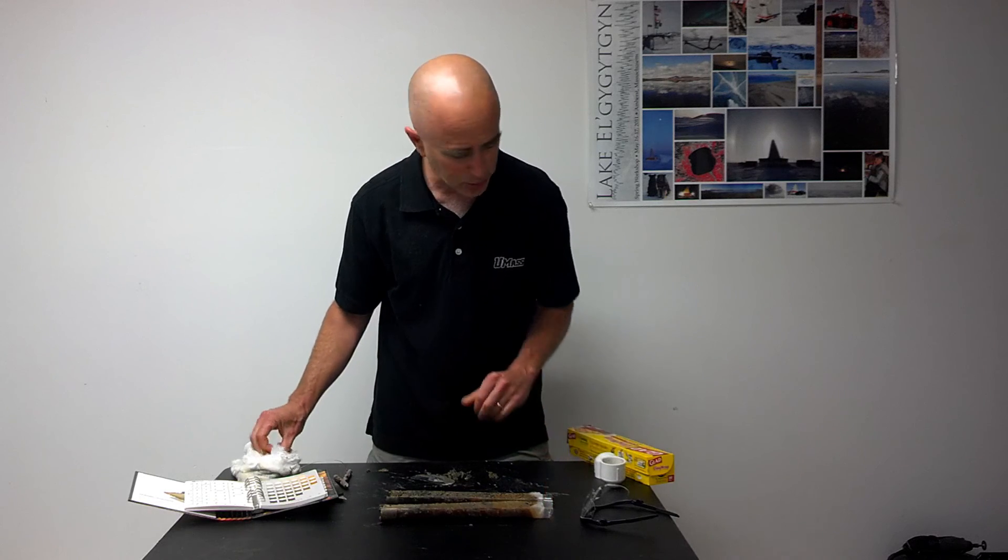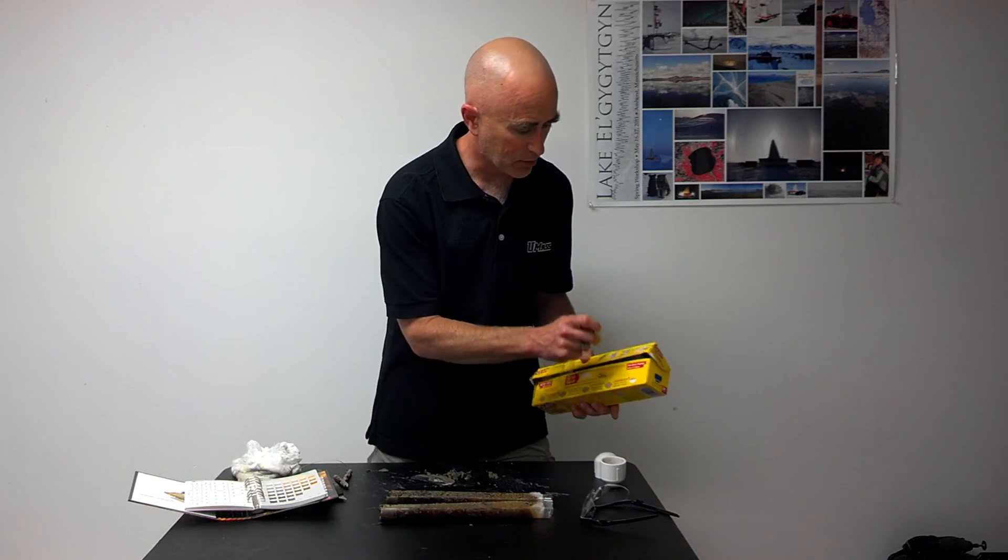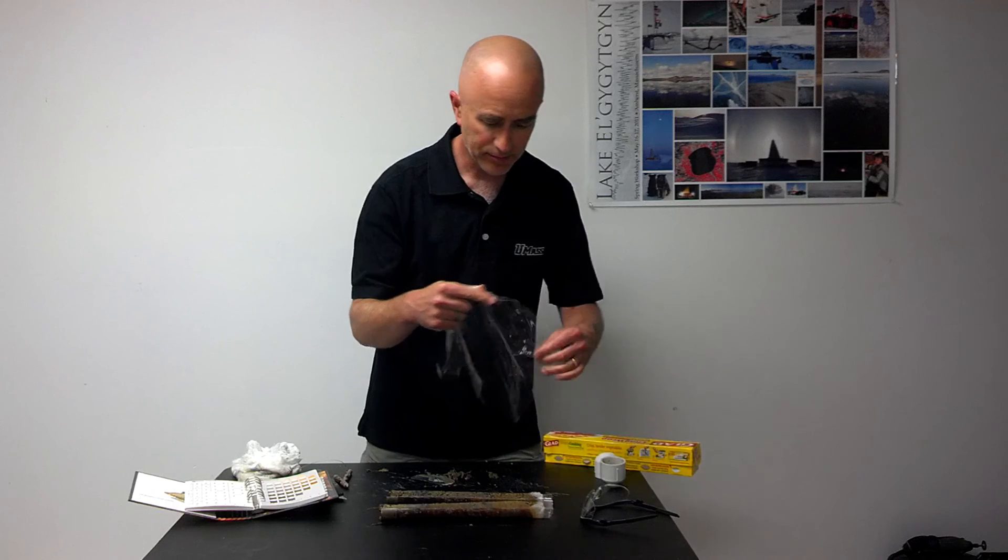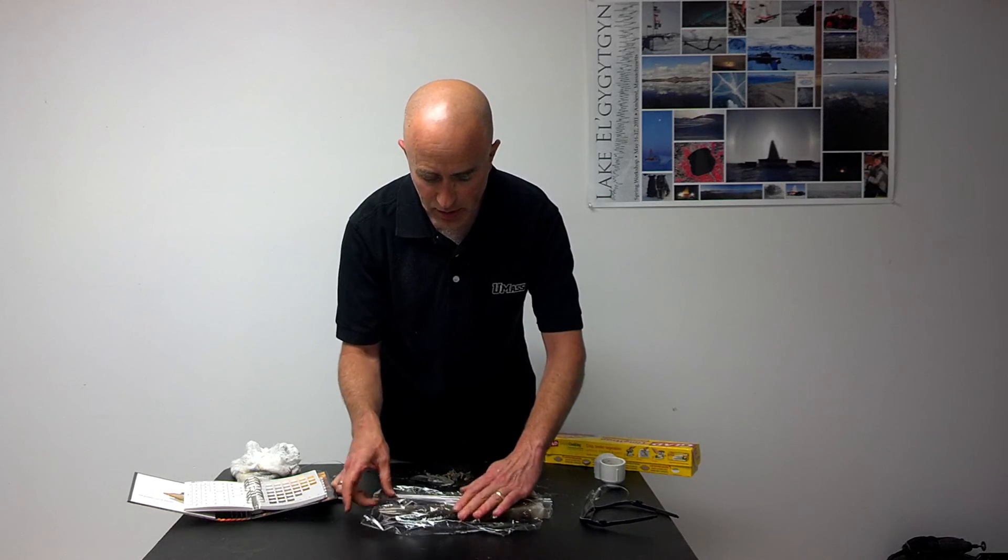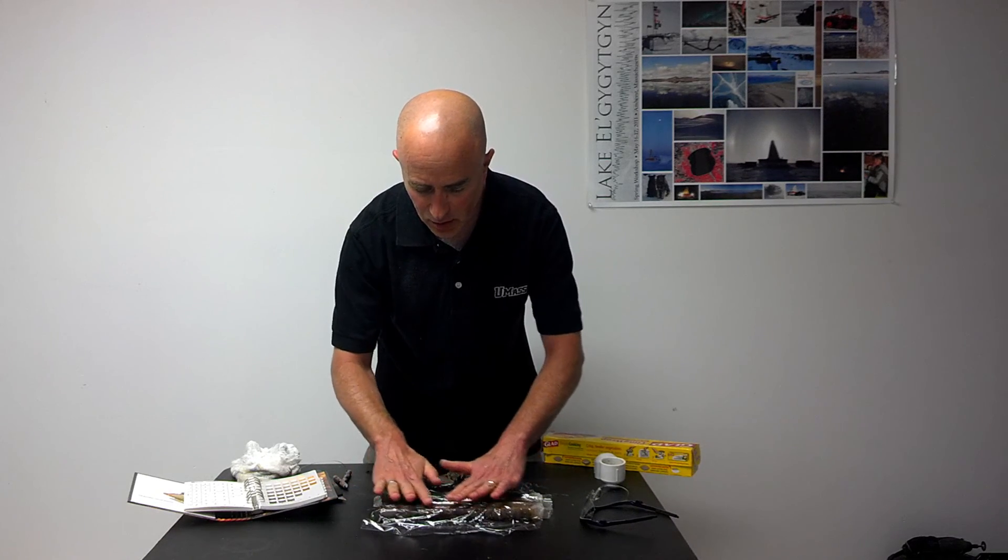If we need to stop and preserve our work, very easily what we can do is take a piece of plastic wrap, cover over the sample, and gently push it down over the sediment. That will preserve it and keep the surface from drying out so we can evaluate it later.